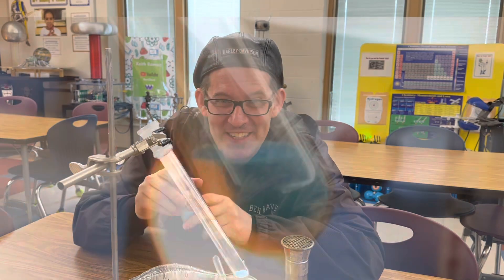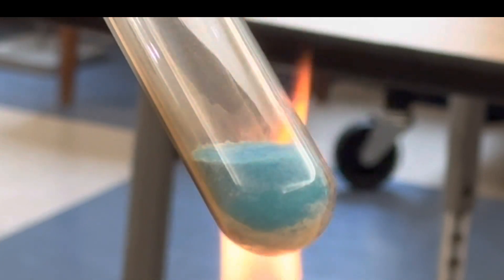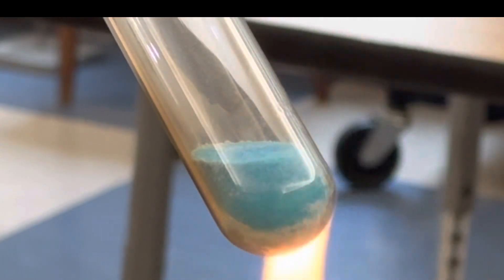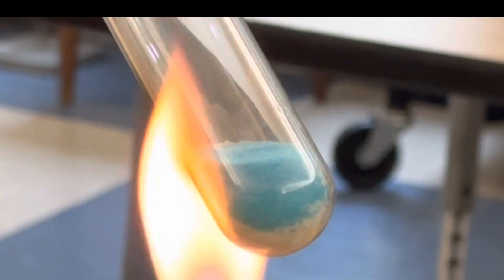Let's start the reaction. Now you're ready to start heating up your copper sulfate pentahydrate and you'll start to see it slowly turn white as it becomes anhydrous copper sulfate.